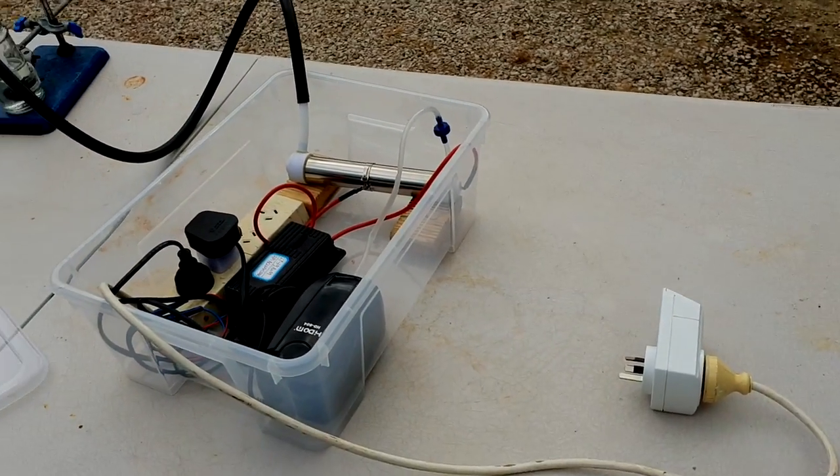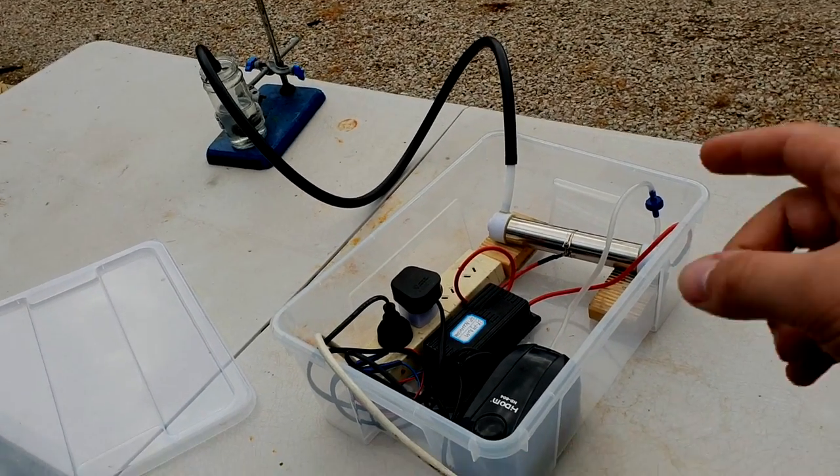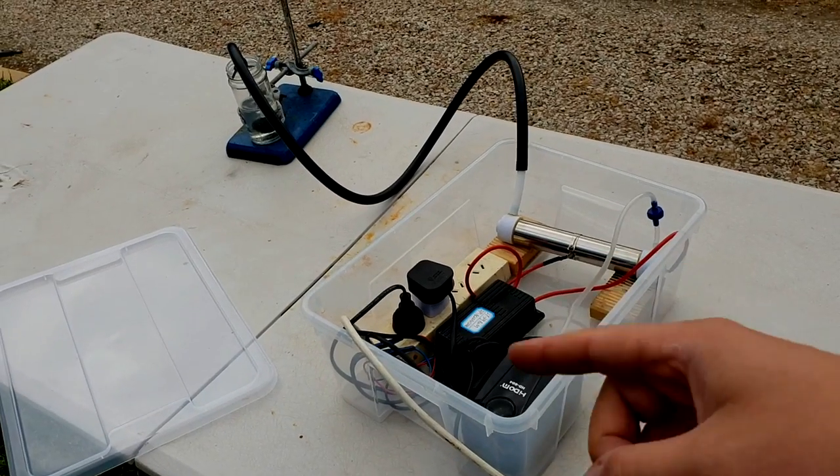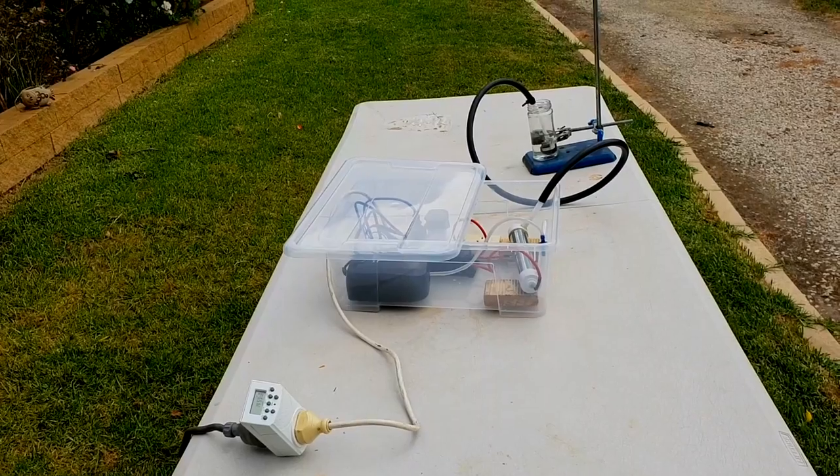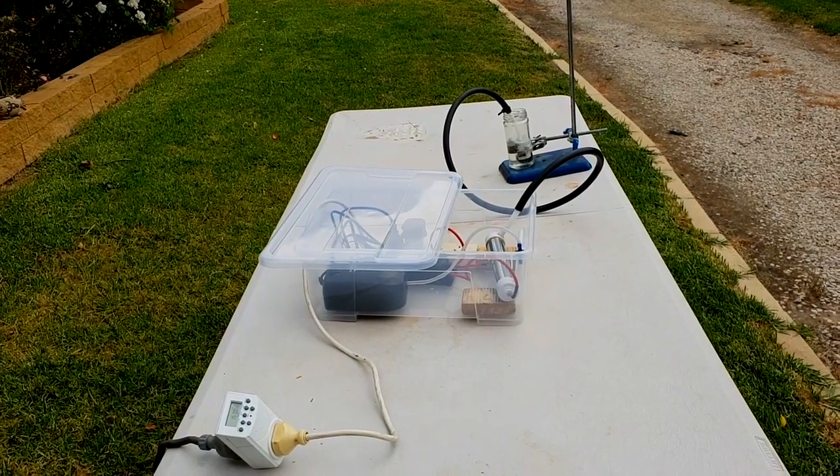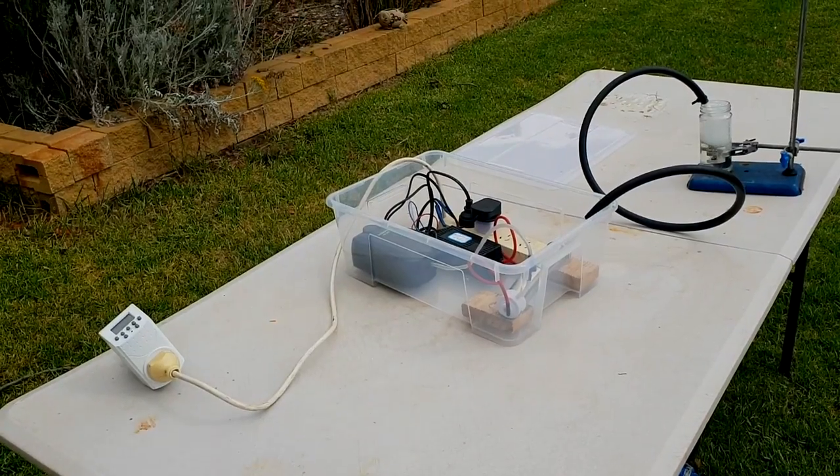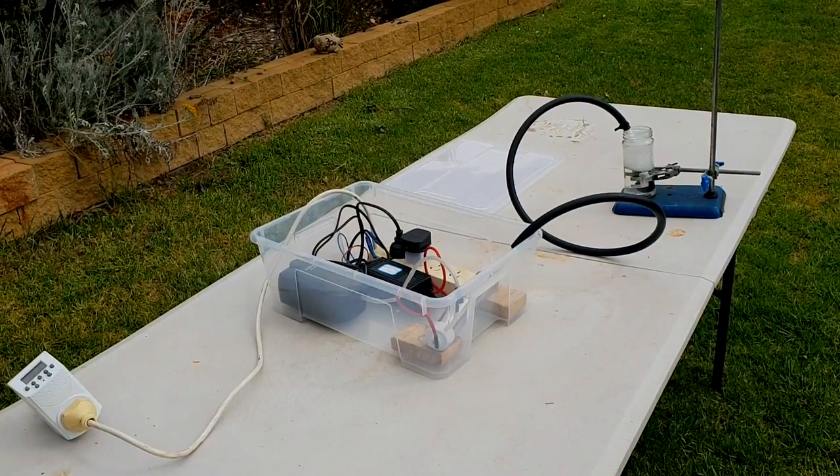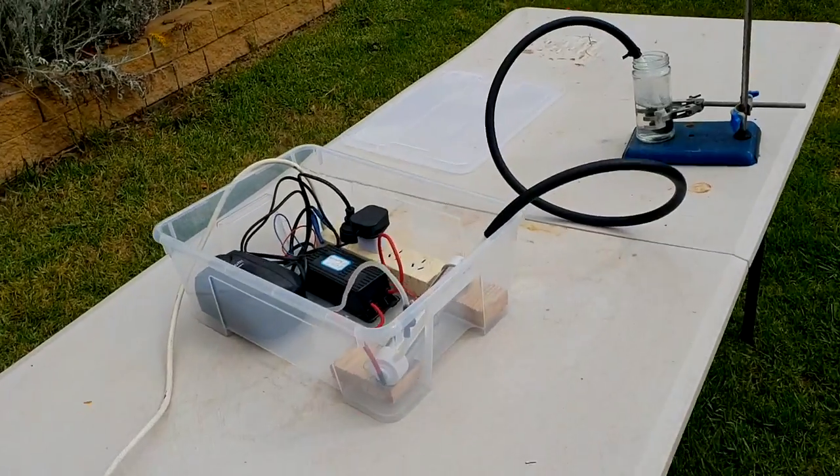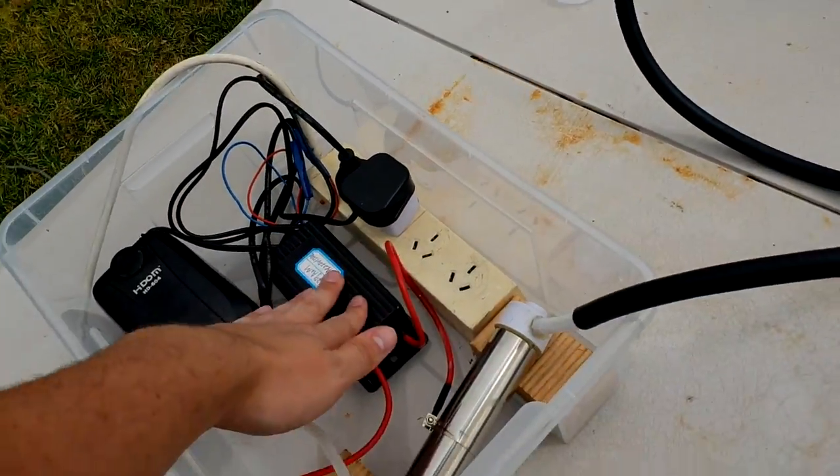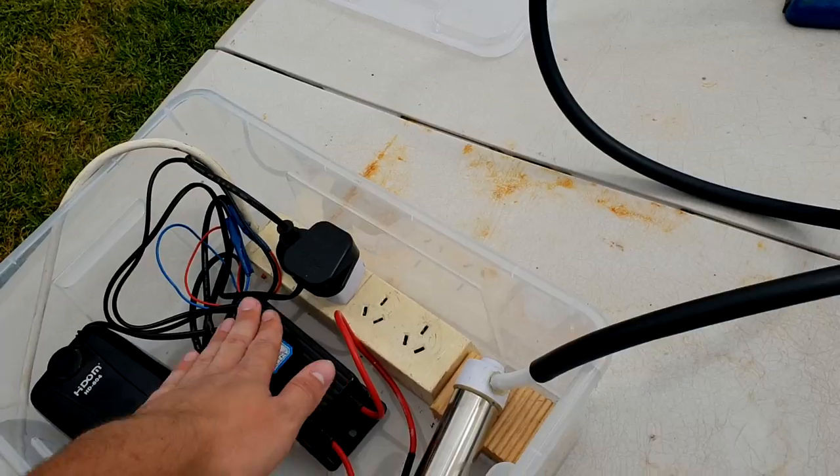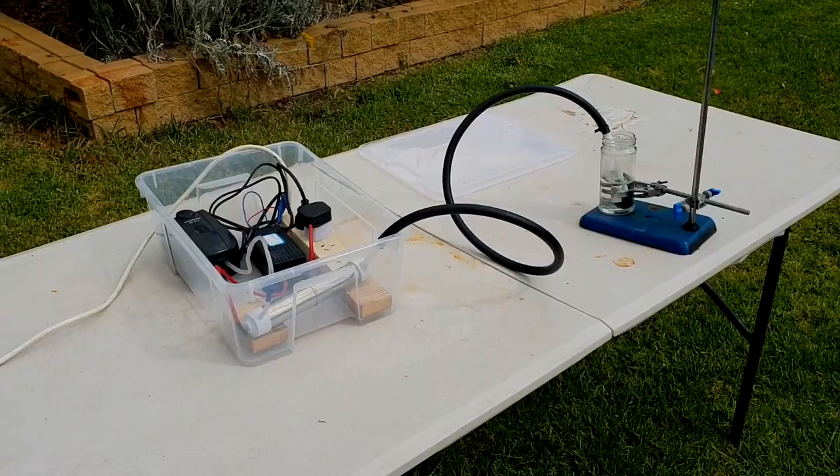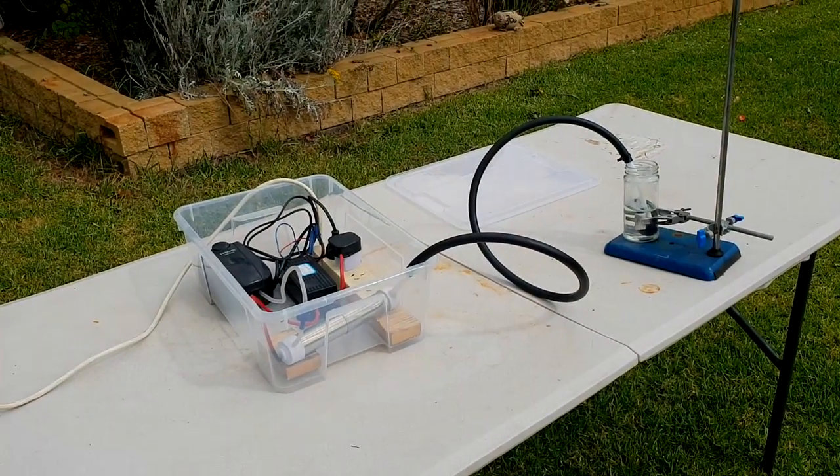The timer is set so that it turns on for three minutes, then off for three minutes. I still haven't got the cooling system installed, so perhaps that will be on for too long, but we'll just have to monitor that. So it's done the on for three, off for three for half an hour now. So it's gotten warm, but not overly hot, so I reckon with the cooling, we might be able to push towards four on and then two off, and then it's on for two thirds of the time rather than half.